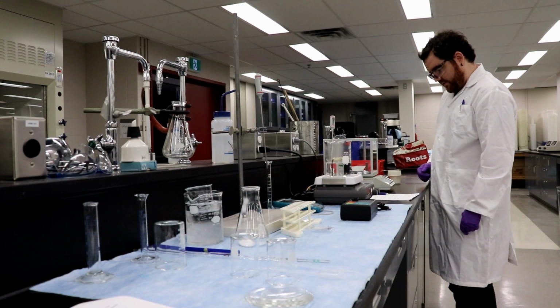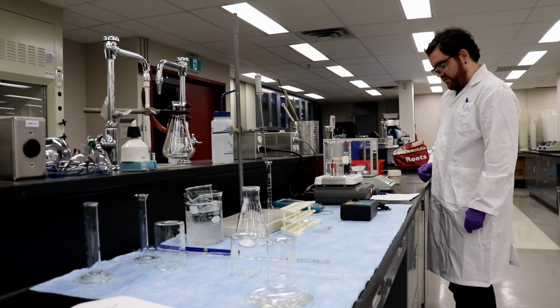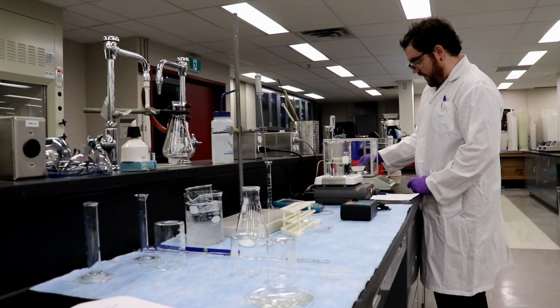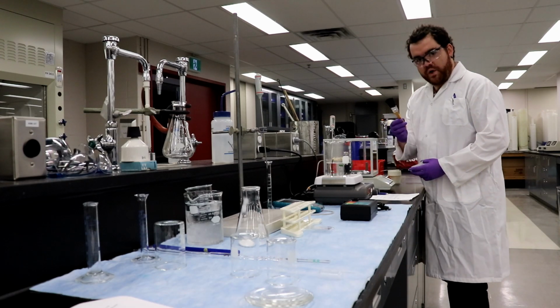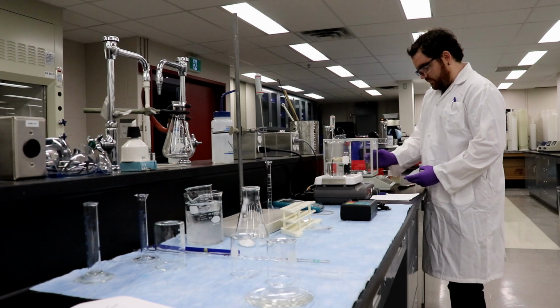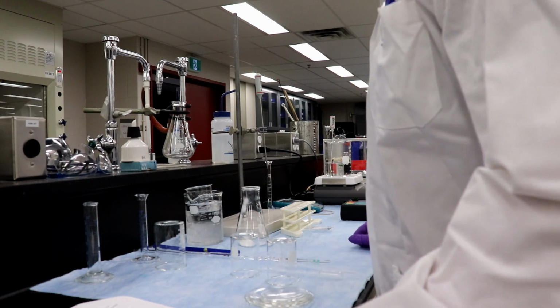Okay, so we have 0.071 grams. So about 0.0710 grams. And then when you do this, you might spill some on the balance like I did, which is why you have your brush, and you just brush that off so that Ingrid and I don't kill you. Okay, that's done. Balance goes off for now.